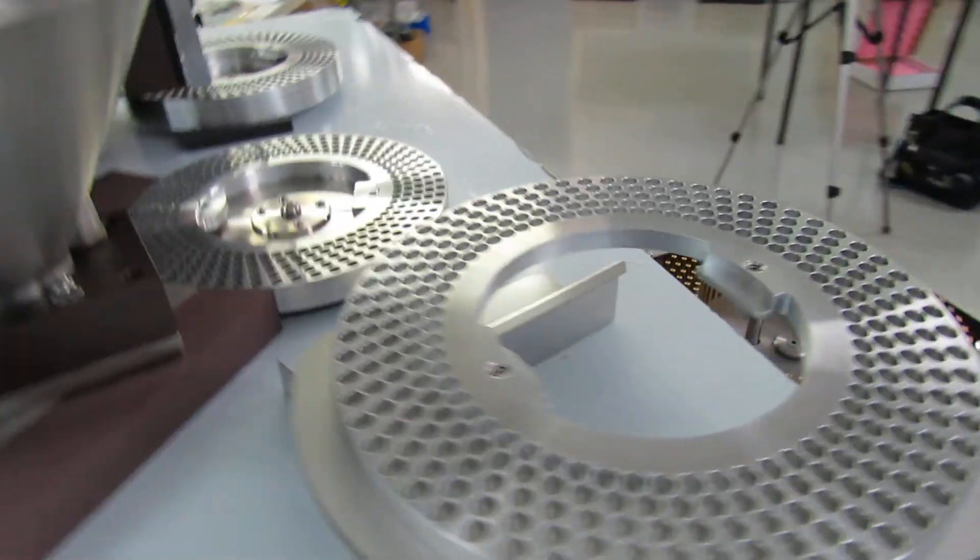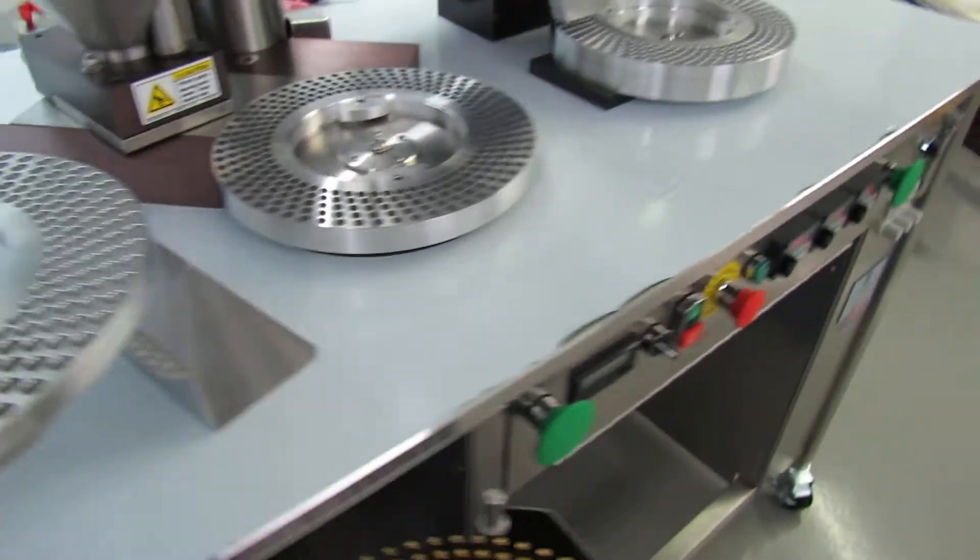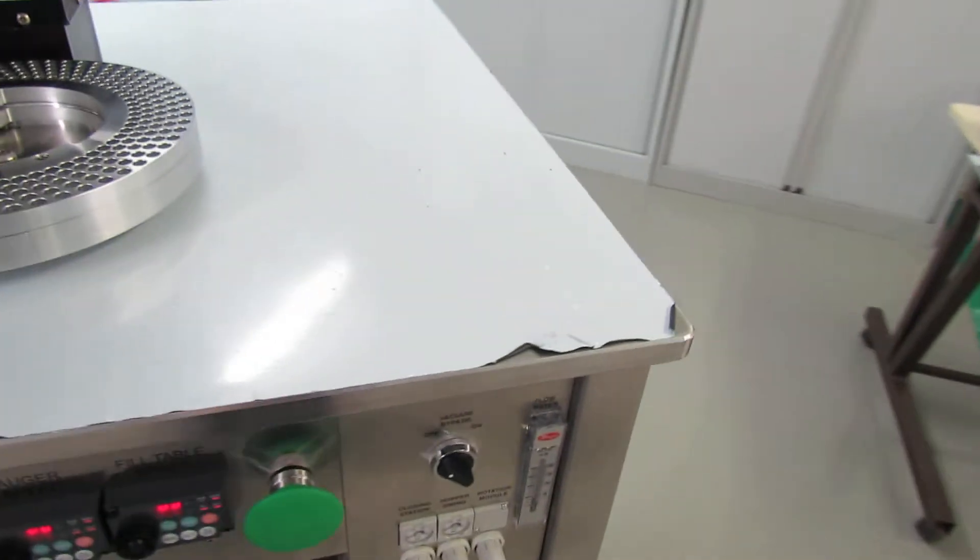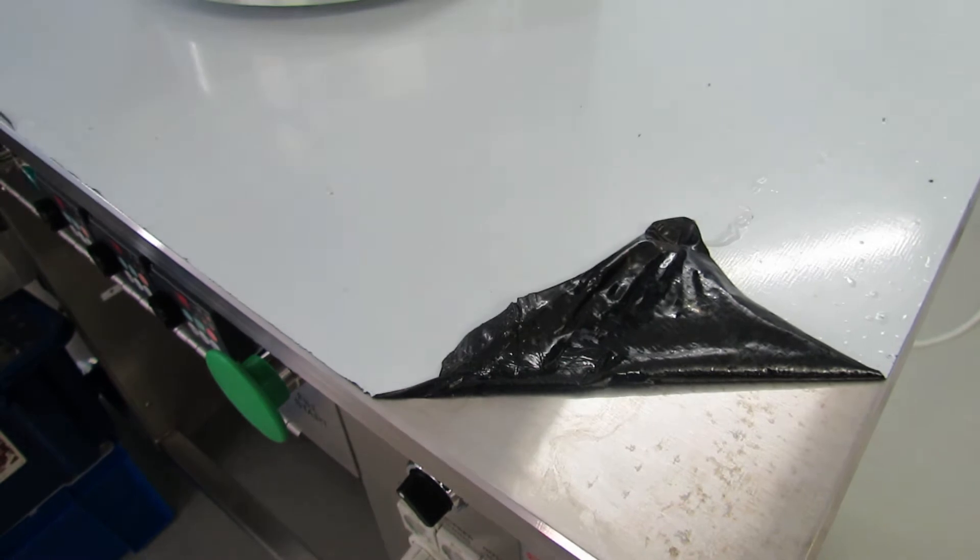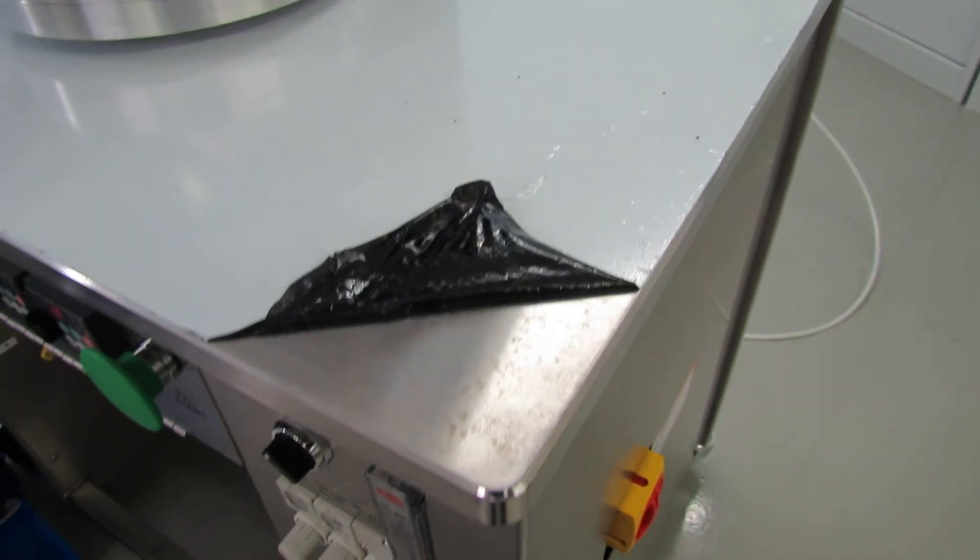And before the machine arrives with you, this is a protective cover which is removed prior or upon installation.